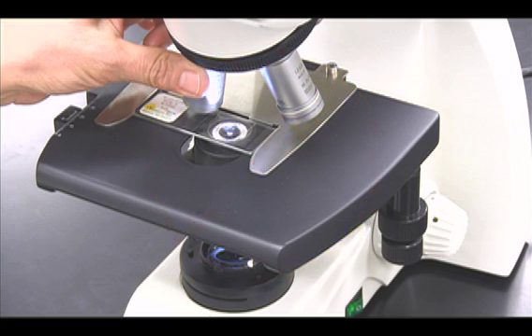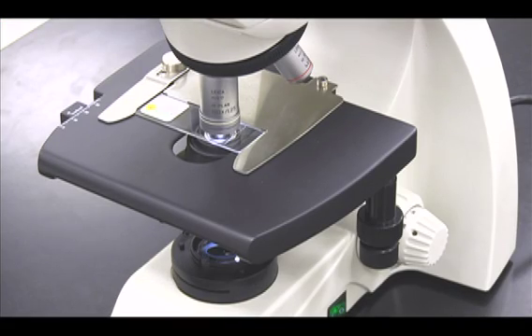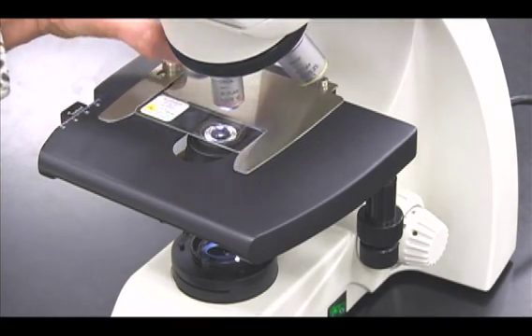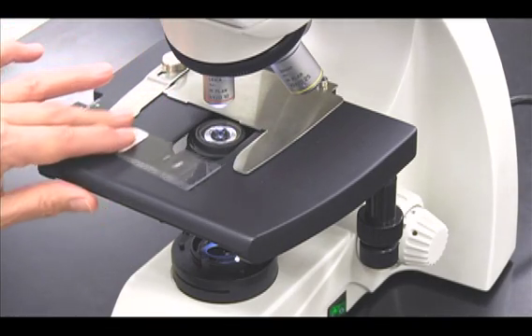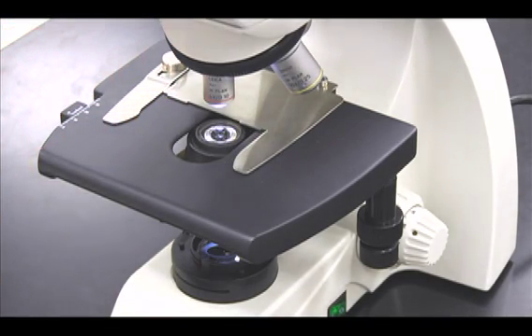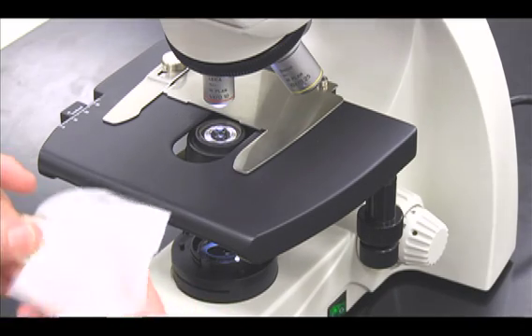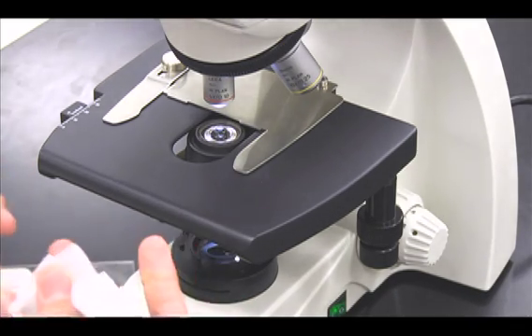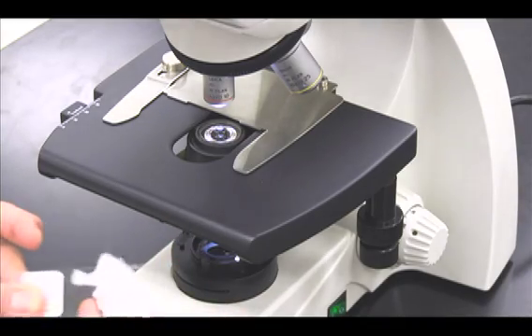If you are unable to focus the image under oil, do not rotate back to the 40x objective. You will have to start over with the 4x objective. Thoroughly clean your slide and refocus through the objectives.